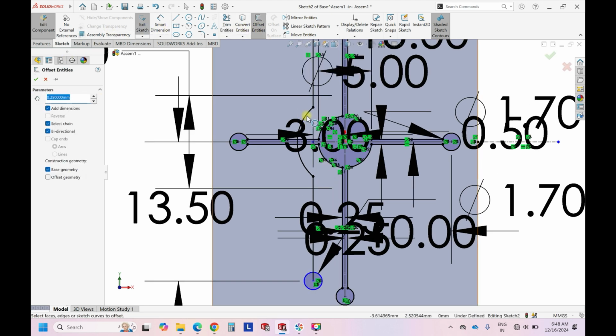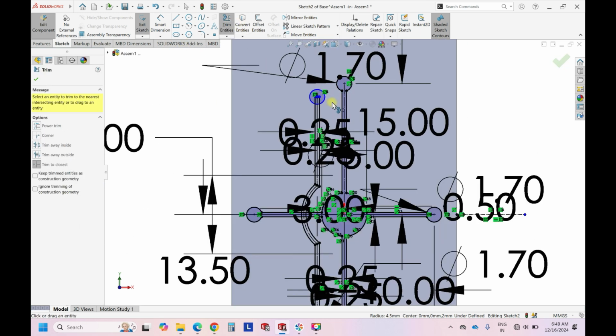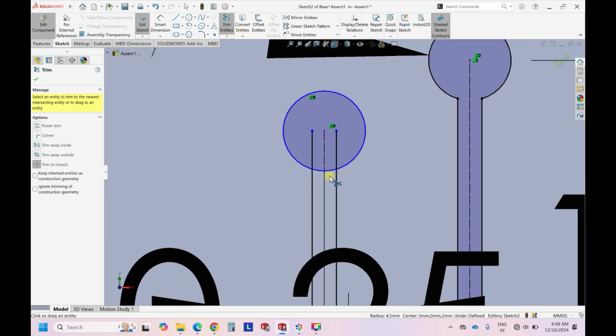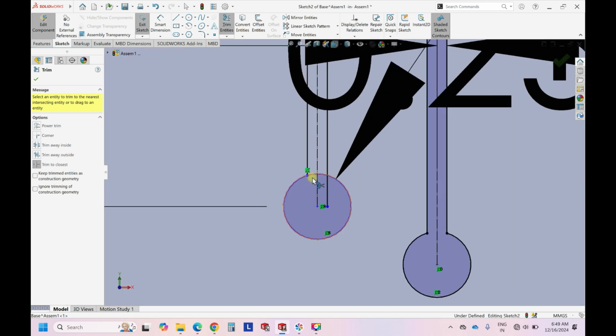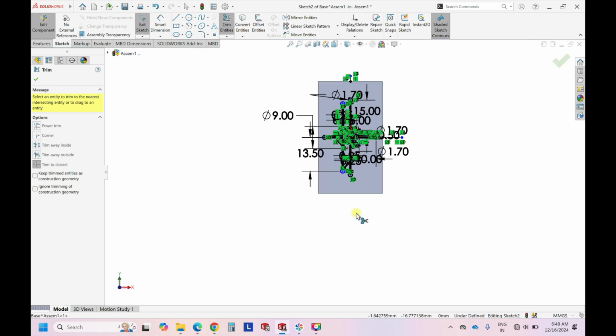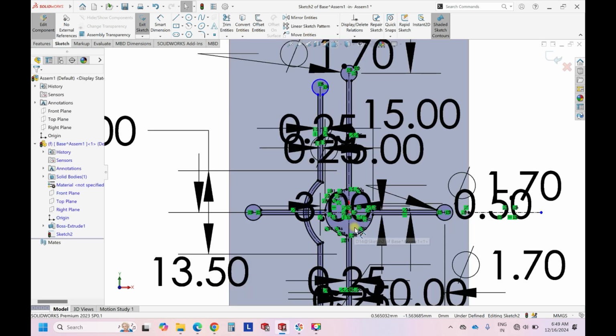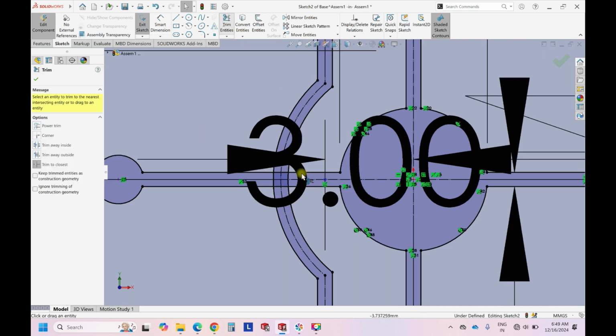Again, use the offset entities. Use this option. So in the same way, it is taking the similar dimension of 0.5 mm. It is a 500 micron channel we are creating. Click OK, and then we can just remove this. Okay, so these two circles are yellow because, and also we have to remove this.